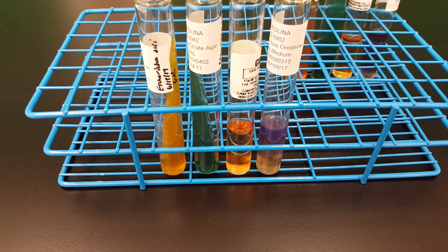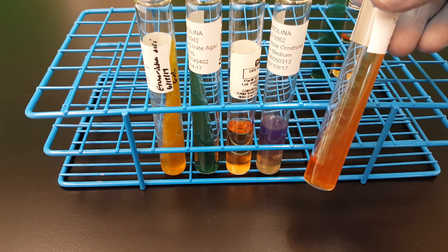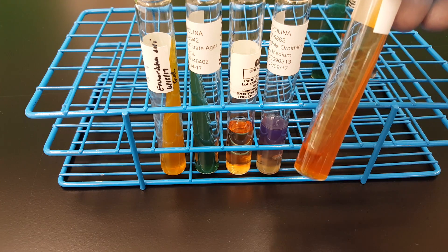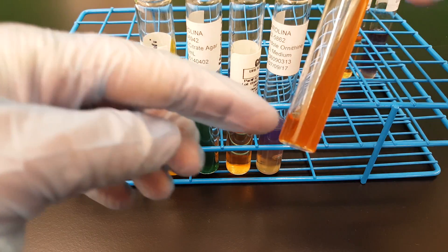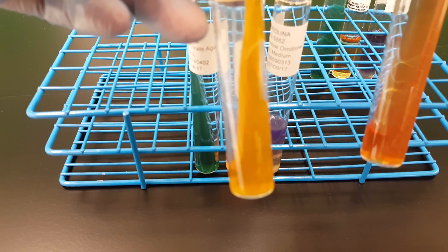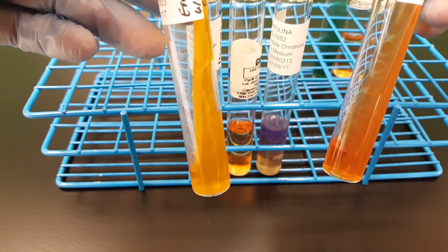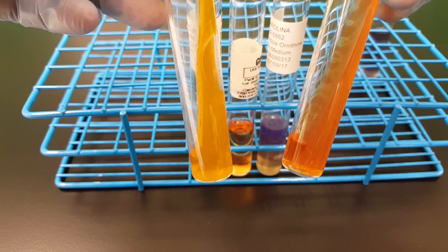So how do we interpret them? Well, this is the original TSI slant. It has three sugars in it, which we're looking to see if the organism actually ferments those sugars. In the butt of the tube we have glucose, and in the slant we have lactose and sucrose. An acidic environment will produce a yellow color, indicating fermentation, while a red color indicates an alkaline environment and no fermentation of that sugar.